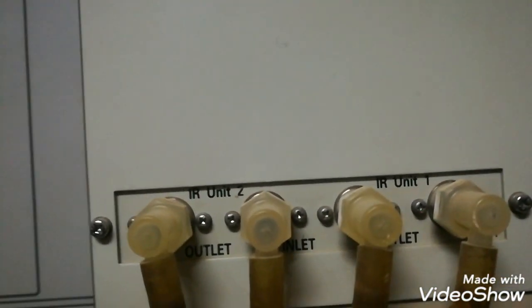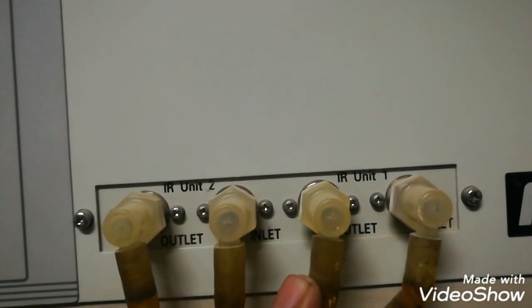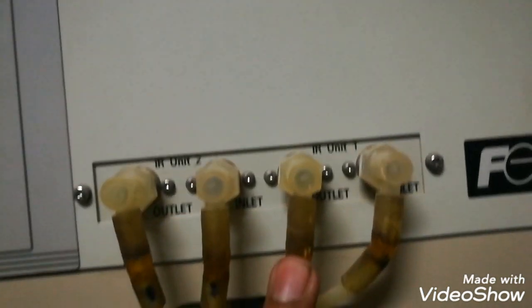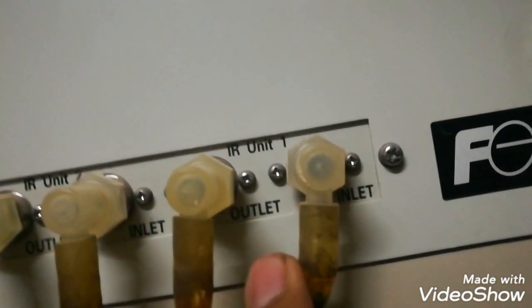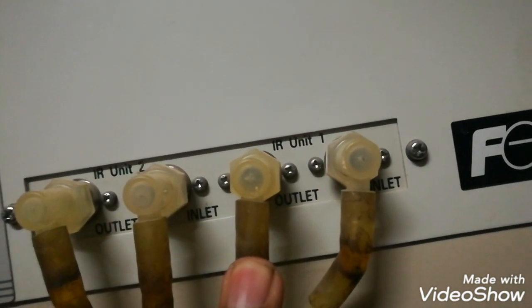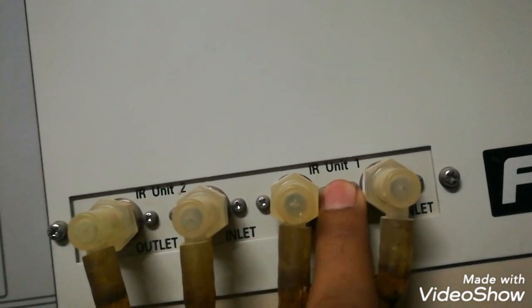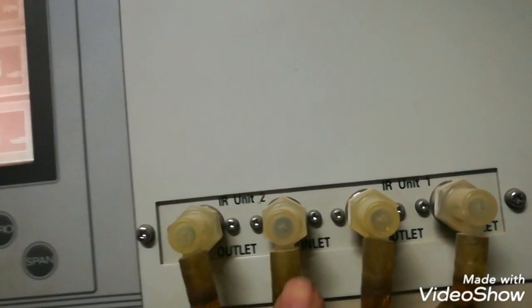At IR Unit 1 we are supplying the NOx, which will measure the NOx concentration. Then we take the gas out, and it goes to the oxygen analyzer. IR Unit 2 is used to measure carbon monoxide CO.